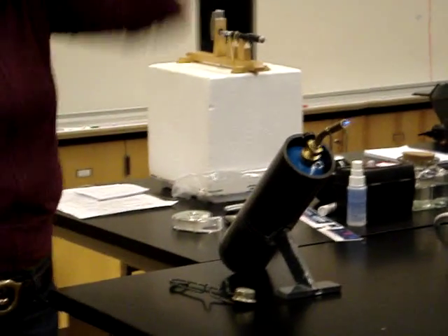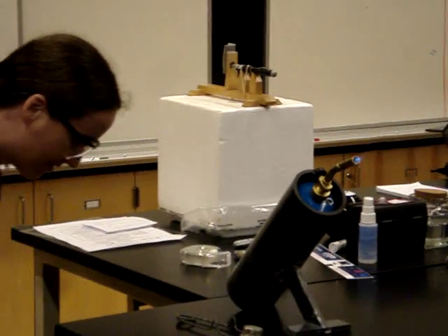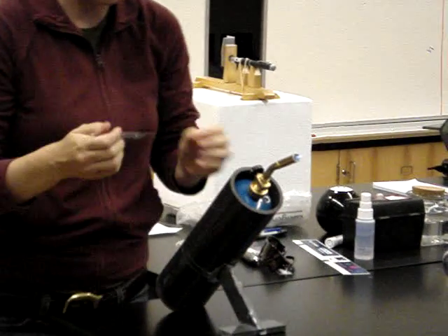Ready for this stuff. Okay, she's ready though. All right. Now I've only done this a couple times myself. I'm going to get that to you right now, but it's really not too difficult.